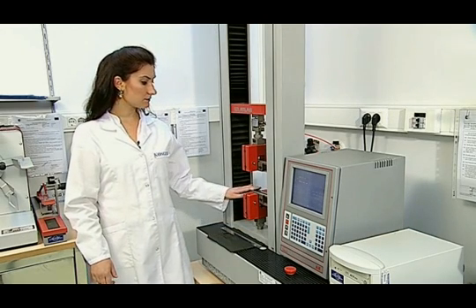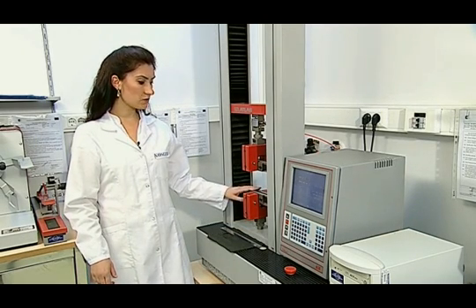Firstly, the device is made ready for testing. To do this, appropriate jaws are placed in the device.